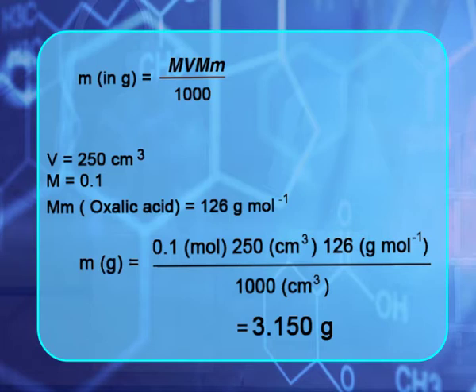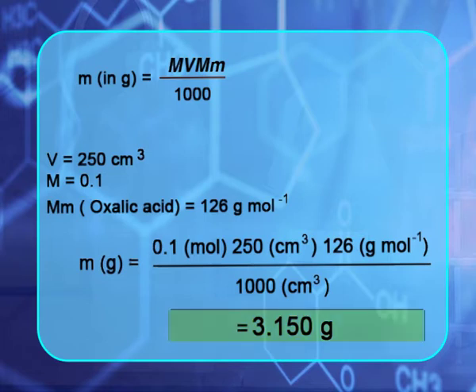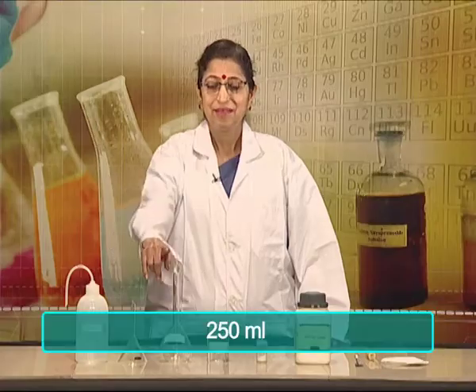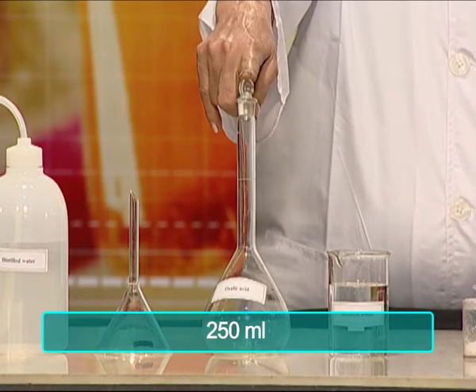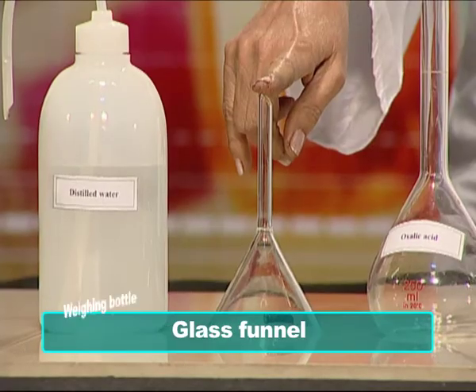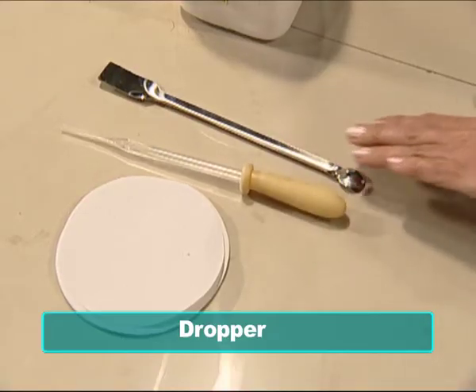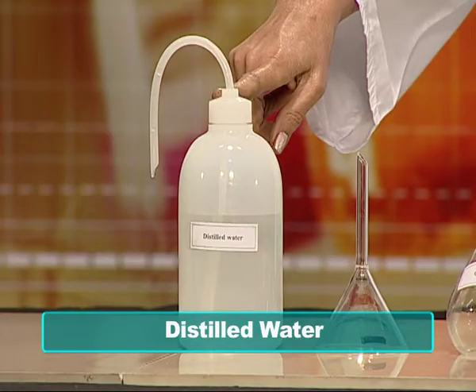Substituting the values in the formula, we get the required mass of oxalic acid, that is 3.150 gram. Materials required are: volumetric flask, beaker, weighing bottle, funnel, wash bottle, dropper, spatula, oxalic acid, and distilled water.